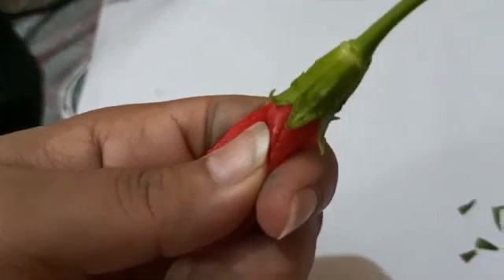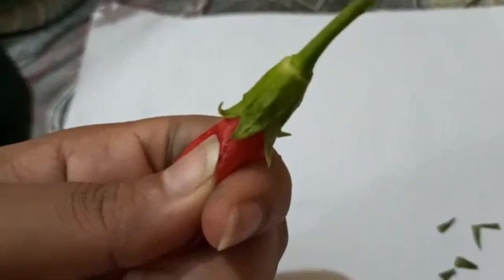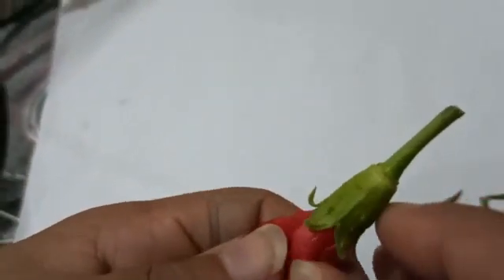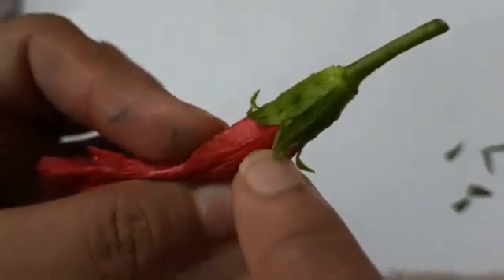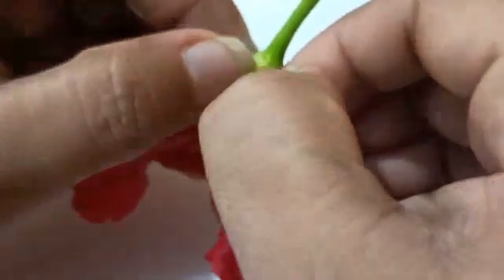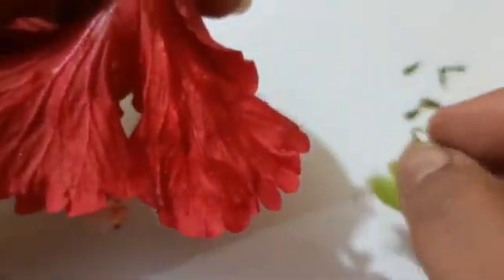After the epicalyx, you can see the calyx. All the sepals are fused together — calyx is the collective term and sepal is the singular one. I'm going to remove it a little so we can count properly: one, two, three, four, and five. This is a gamosepalous condition — five sepals fused with each other making a cup-like structure.